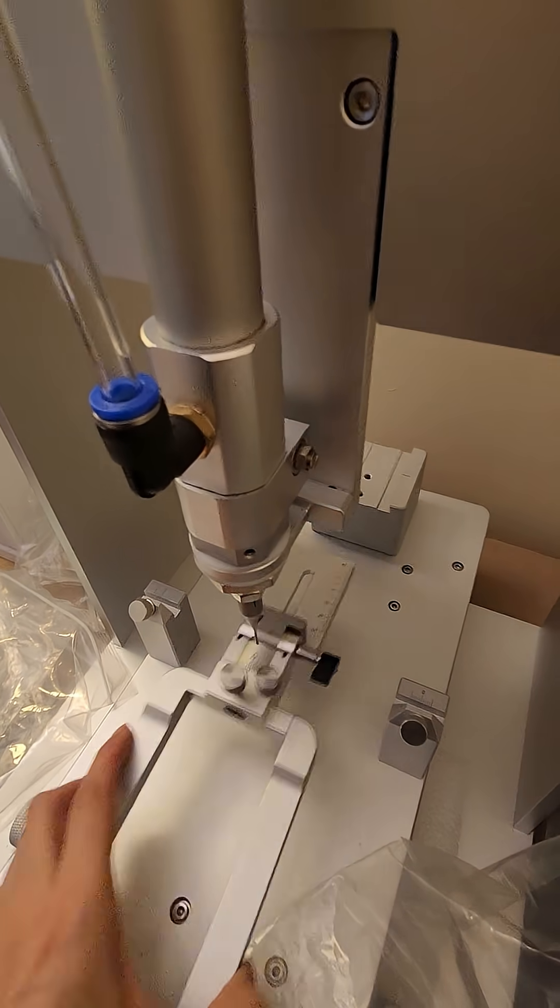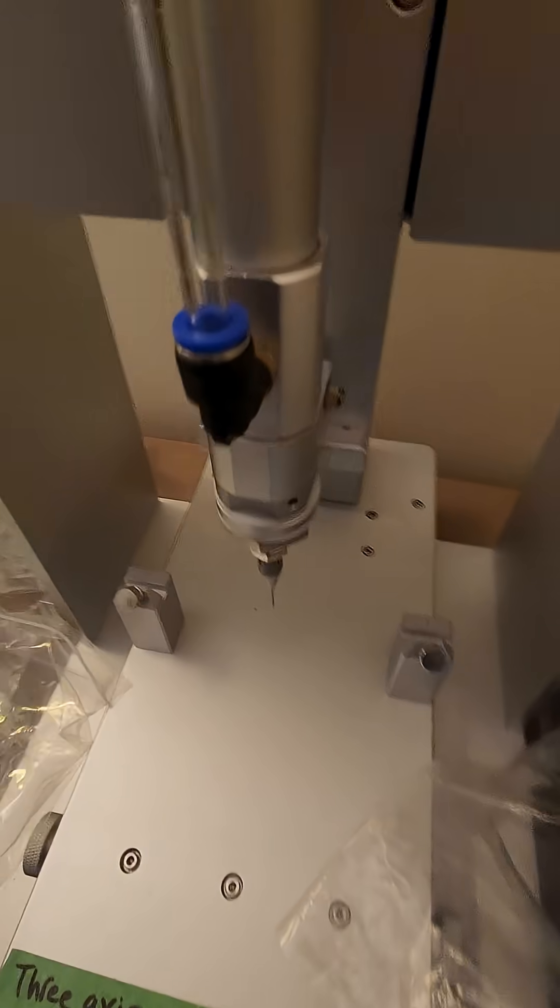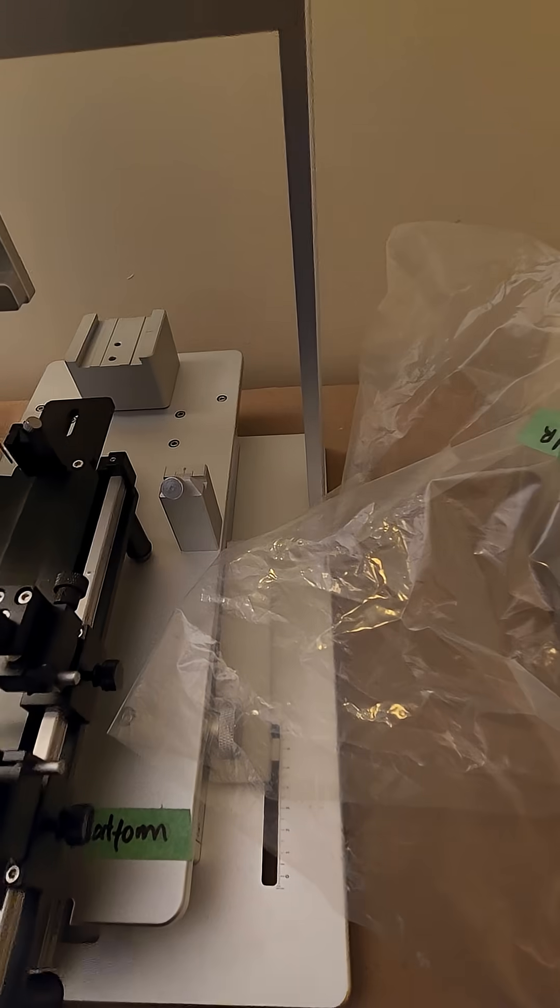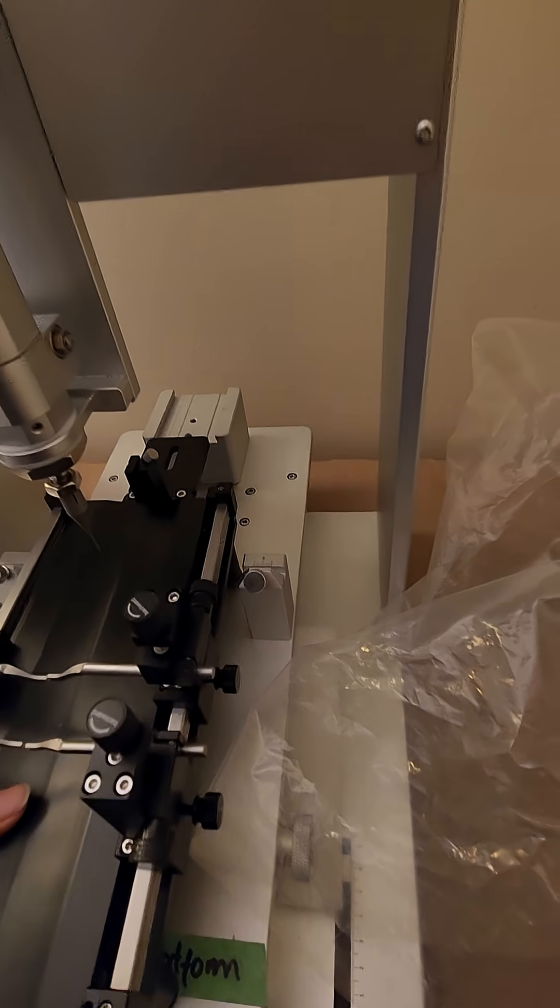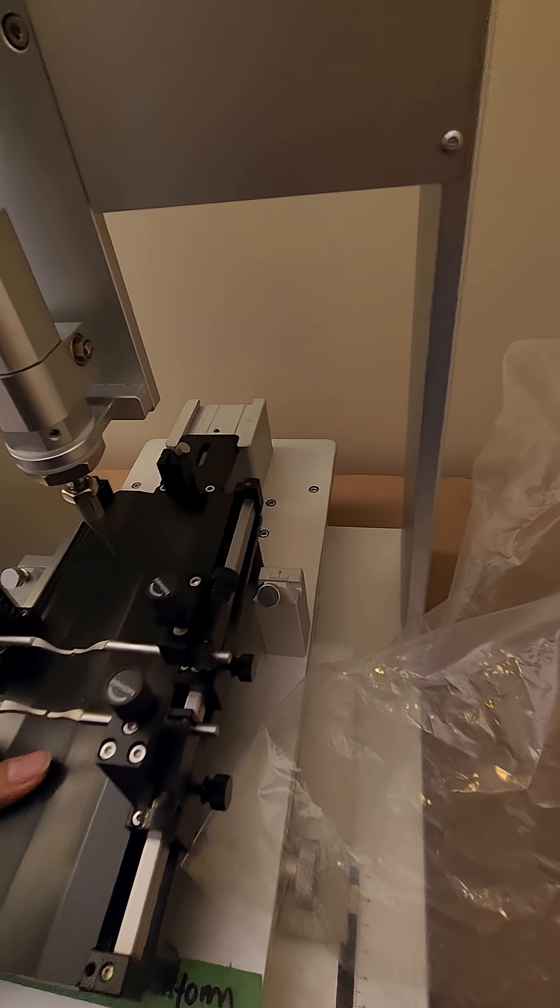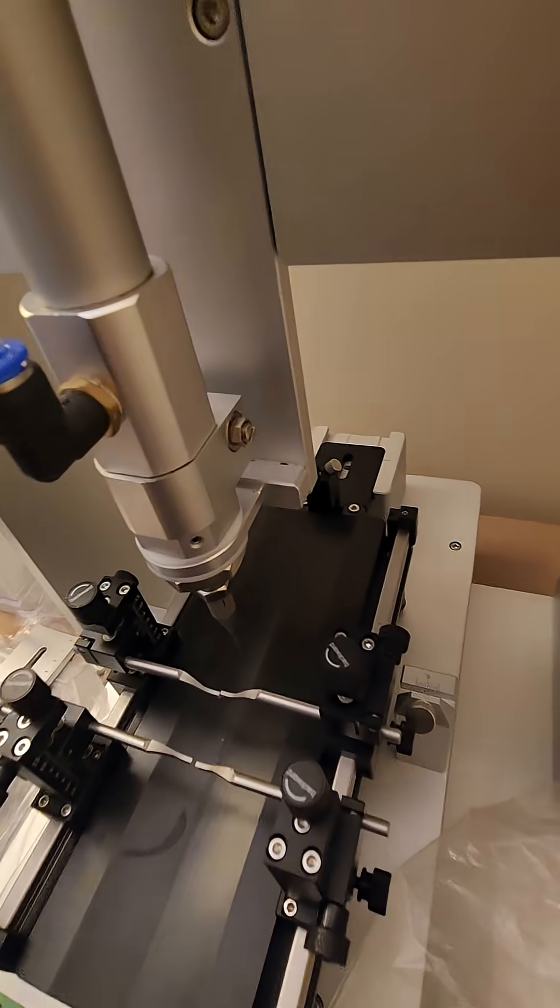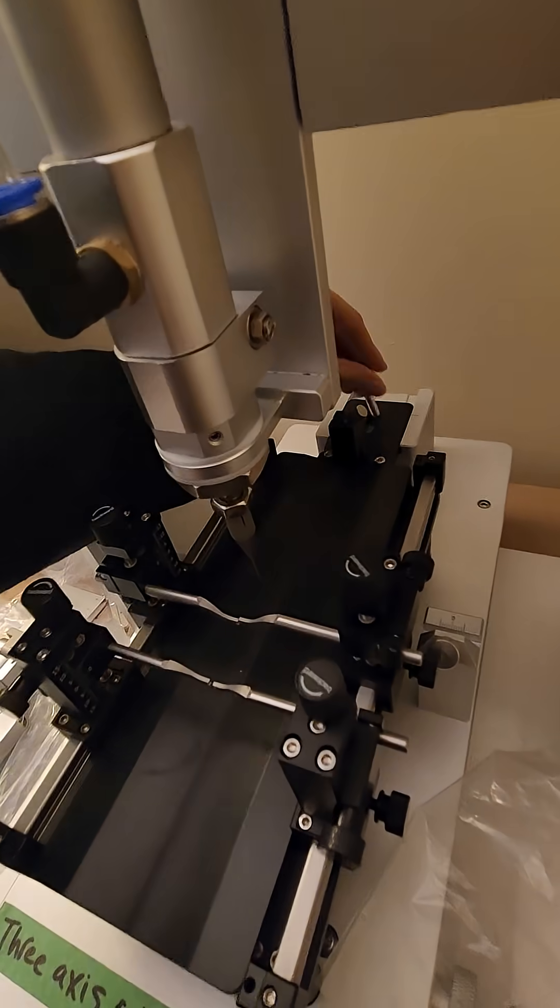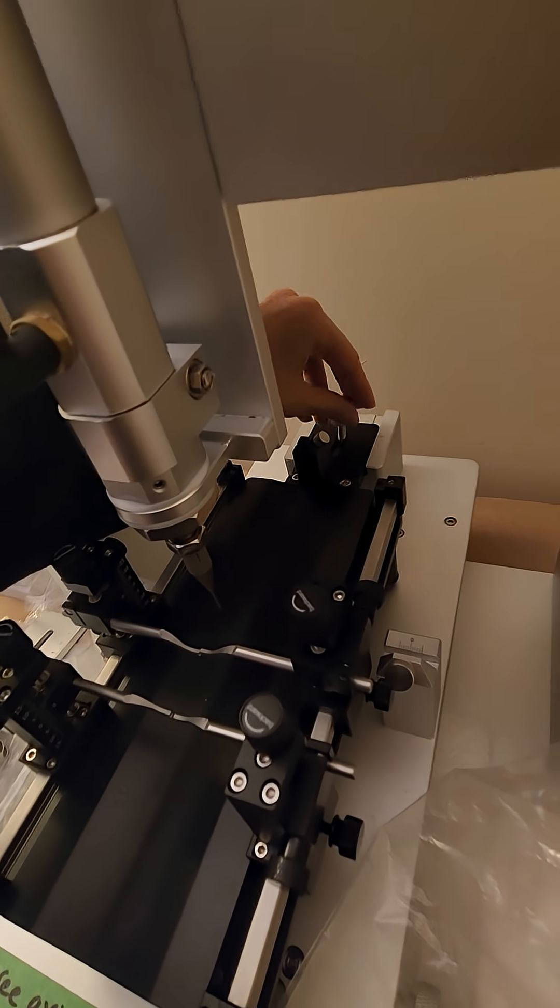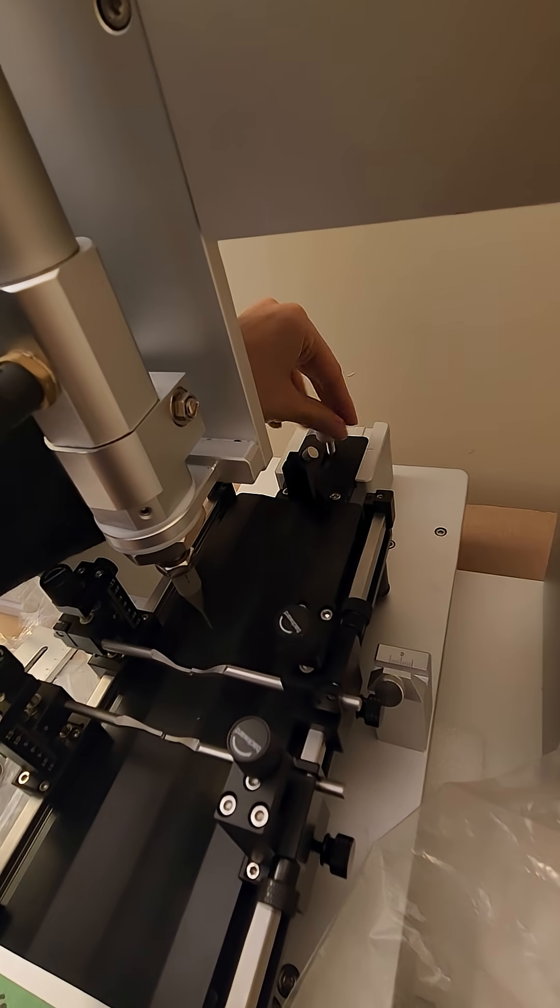To change the adapter, you click the next adapter. So this is the spinal board adapter. You slide this into the back here and screw it in the same way.